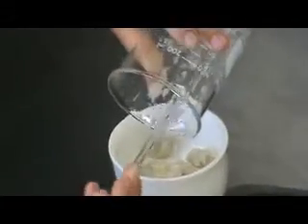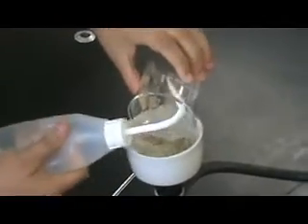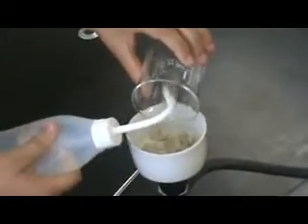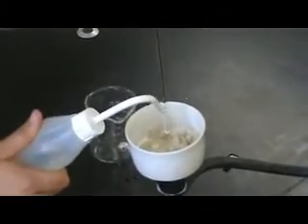To maximize the amount of precipitate, you can use some DI water to wash the beaker. Pour the remaining liquid into the Buchner funnel. Let the faucet run for a minute or two longer to ensure full filtration.